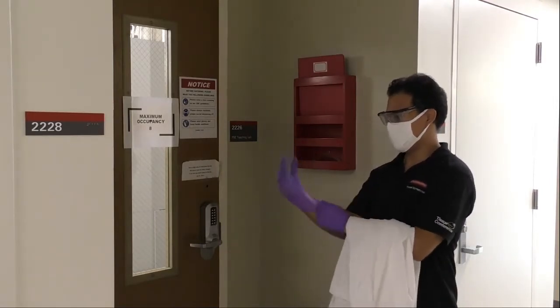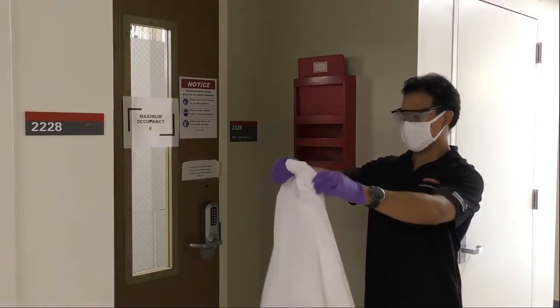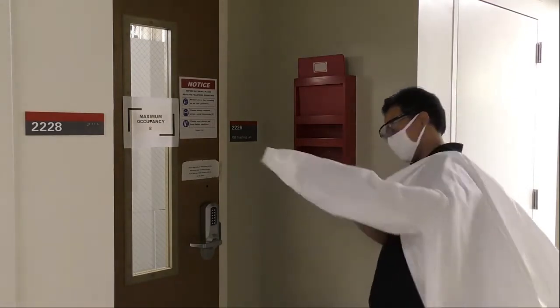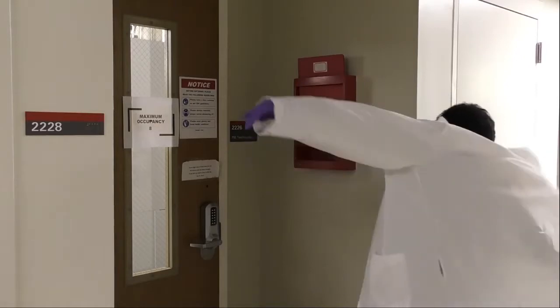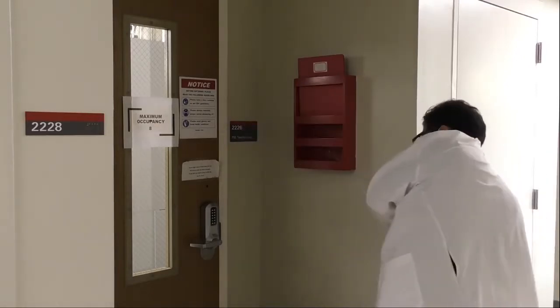But first let me put my PPE protective equipment like my glasses, my gloves, my lab coat and of course my face mask before jumping into the lab.